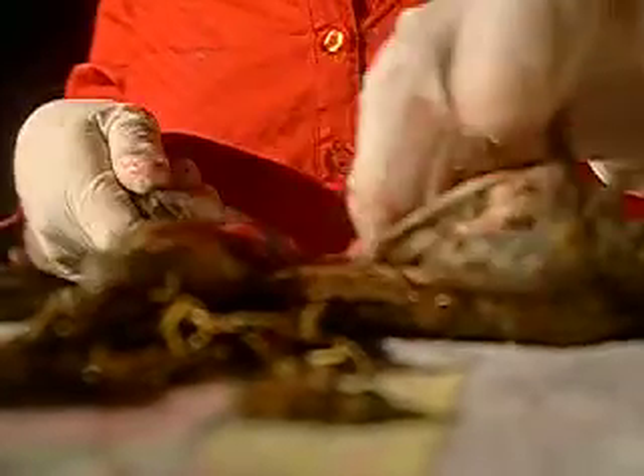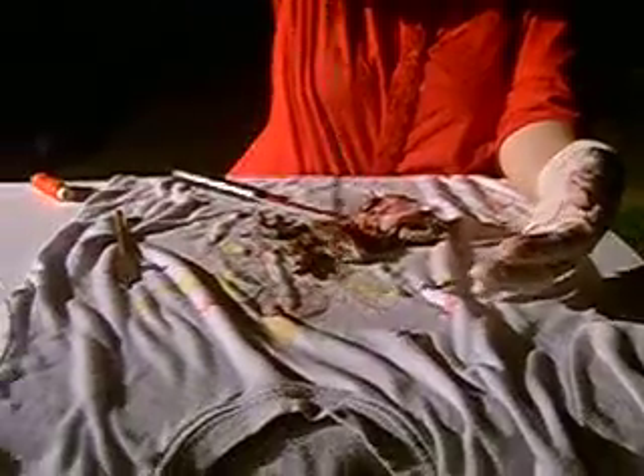I can't believe you're doing that. I'm gonna hold it up to see how long it is when it's out. Hold it out like that — it's really long. See how long its food organs are.